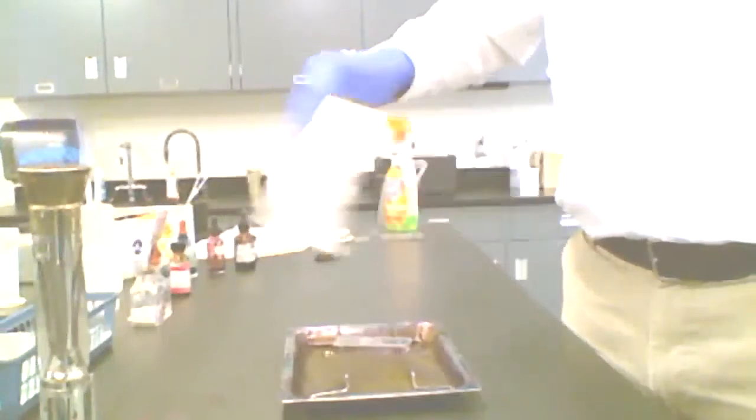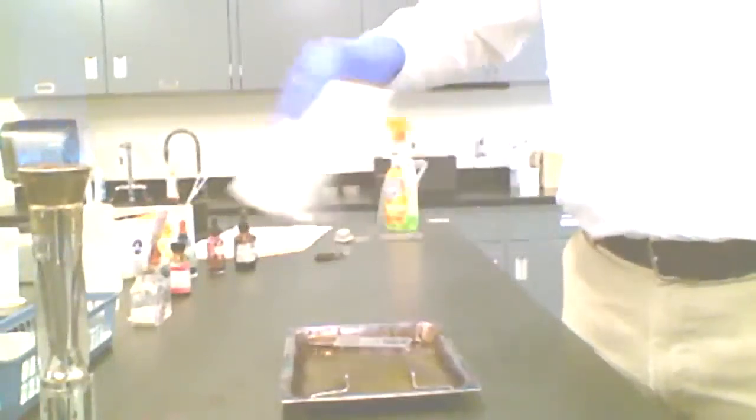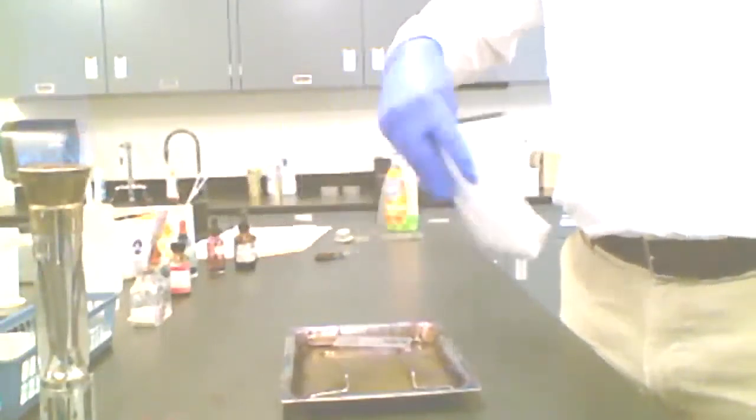While Dr. Ashbaugh is drying the slide, I want to just take a second to mention that he's been demonstrating that a lot of the work has been done with an inoculation loop. And there's some terminology that accompanies that. I'm going to show you on the plate, right there is where Dr. Ashbaugh obtained his sample with his inoculation loop. When he did that, the sample that goes onto the loop is now referred to as an inoculum.